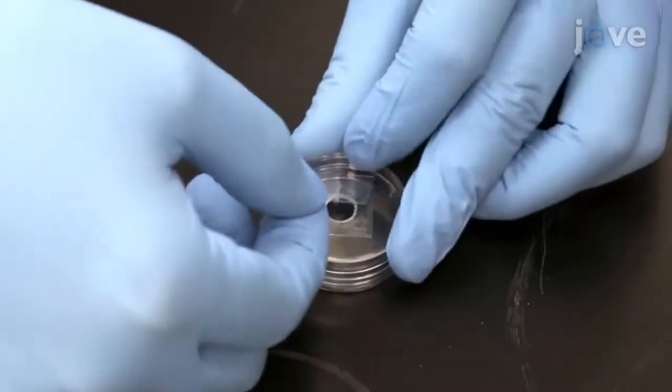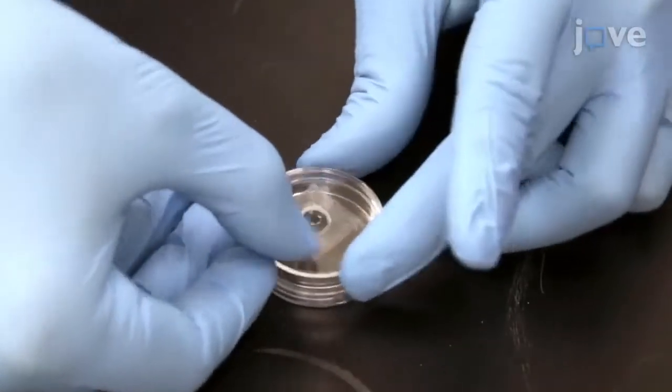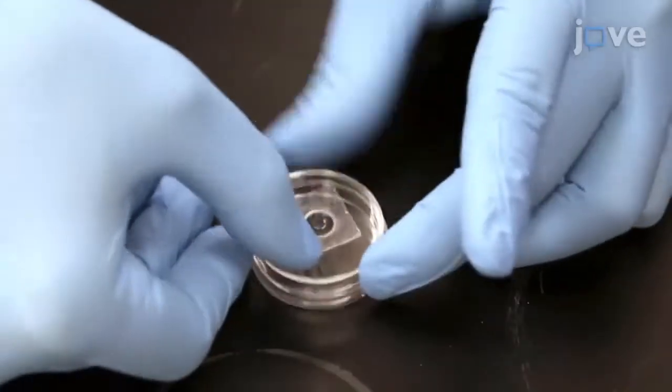Use high-performance double-sided acrylic adhesive to attach an open-bottom petri dish to the cover slip. Take special care when adhering the hydrogel-laden cover slip to the petri dish. A wet dish or too little pressure during the application will allow leaks to form, ruining the sample.